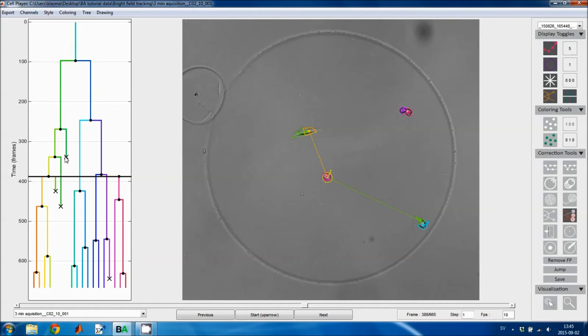If we look at these tracks, they end with an X, and that means that they undergo apoptosis. If you want them to not go through apoptosis, if you want them to leave the image either through migration or by being washed out of the image or something like that, you use this tool, and then you click on the cell, and then the X is removed, and the cell is assumed to leave the image in some other way, either through migration or through some other mechanism. I can do the same thing here. The apoptotic event is removed, and if I change my mind and want to introduce the apoptotic event again, I just click on the same cell using this tool again, and then the apoptotic event is created.